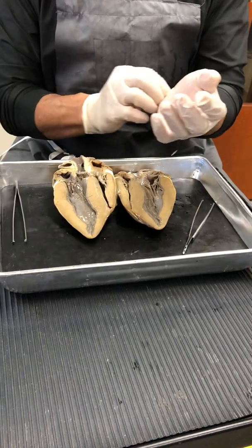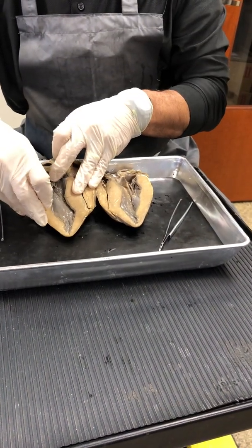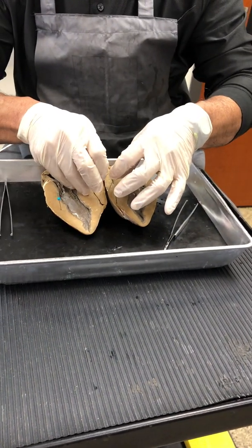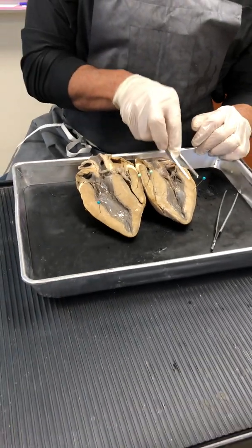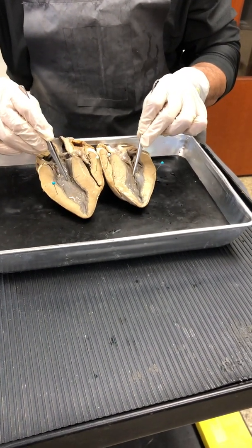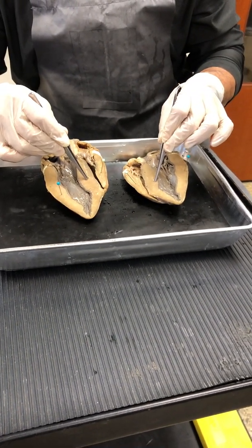My advice to you is, before you do anything else, once you've opened it up, you need to now determine what is the left side and what is the right side. And how do we do that? Different colors. We look at the thickness of the muscle. So there's my ventricle. So we're looking at the thickness of that muscle relative to the thickness of that muscle. Right? So what do we see, folks? This is thicker than that. This is thicker than that. So what does that mean? This means that this is the left myocardium and this is the right myocardium, which means that this is the left ventricle. That means that is the left atrium. That means that this is the right ventricle and that is the right atrium. There's the interventricular septum right there.